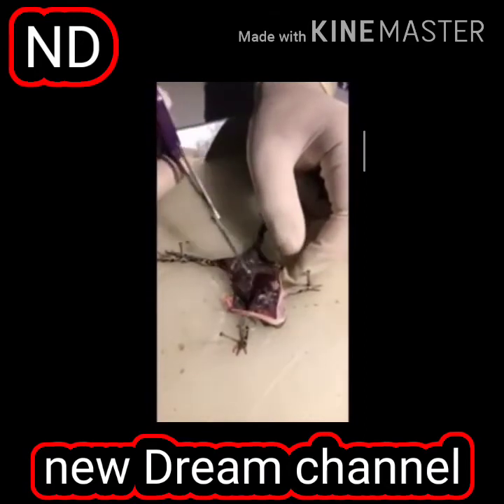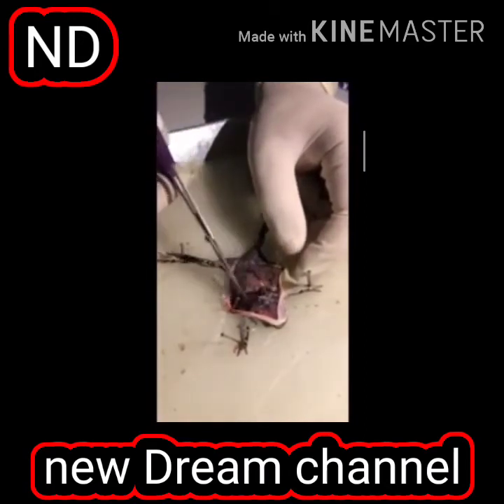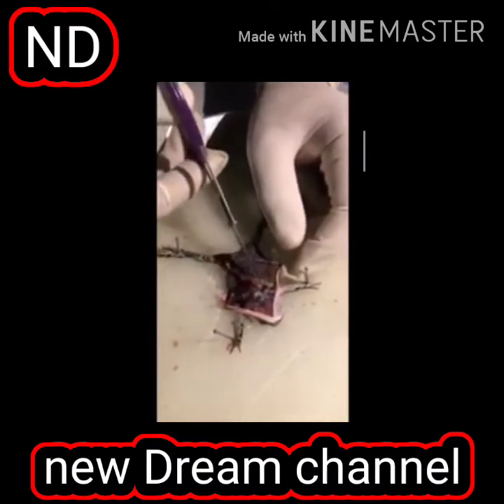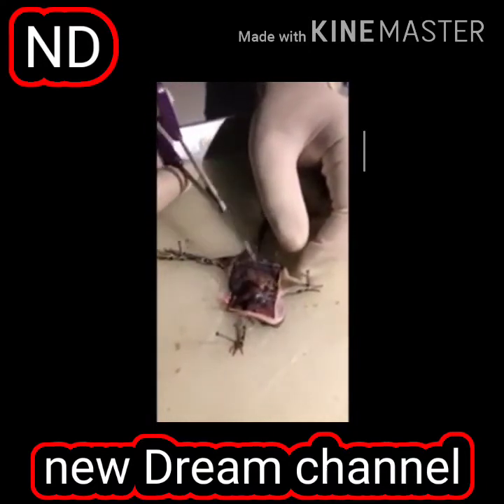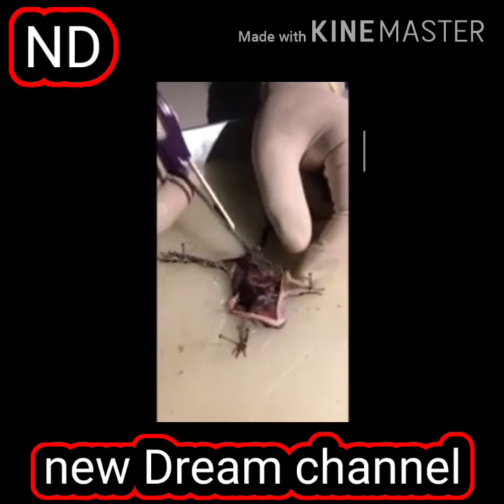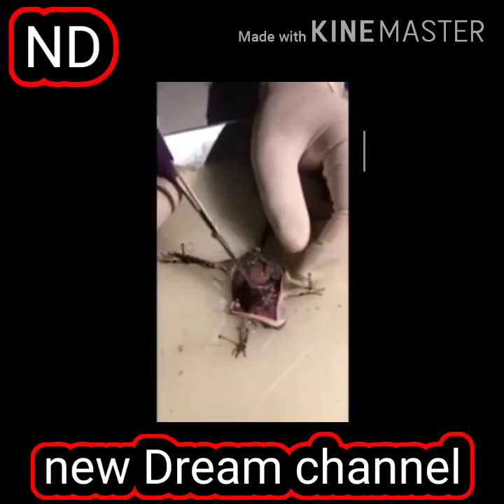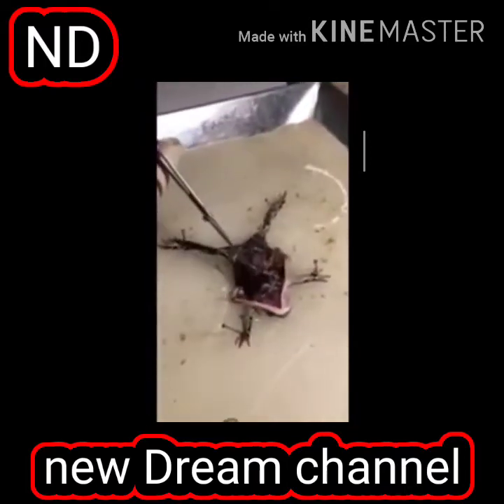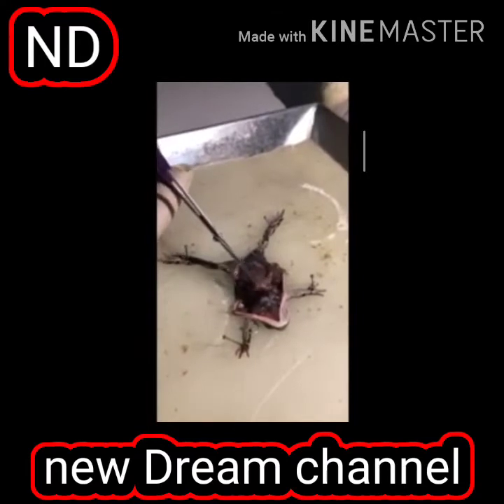So peritoneum covering the white, and when you see here, if we move here, likewise, this is the intestines, but here you see better one more thing, that it comes from here. What is this? This is the esophagus. It will come from the buccal cavity here. This is the esophagus.